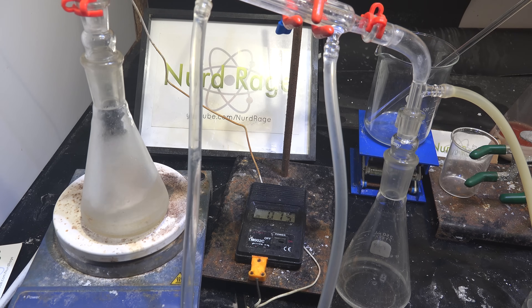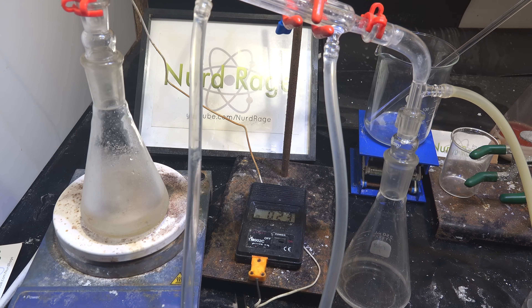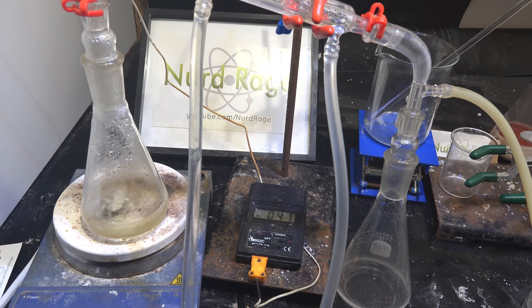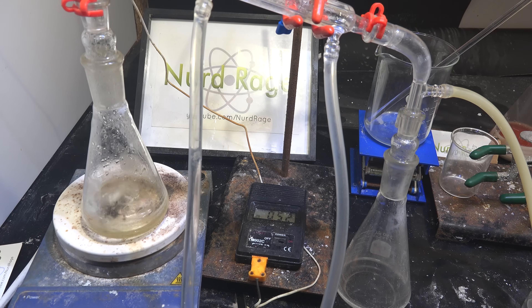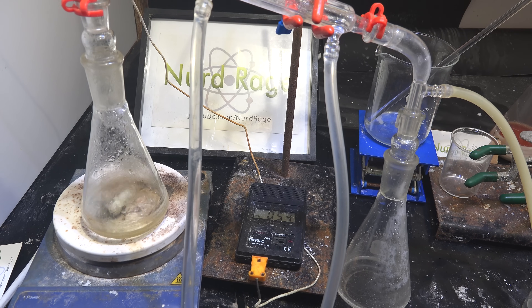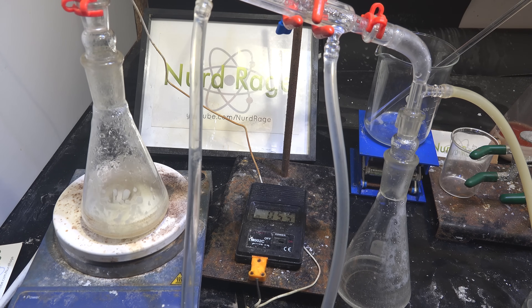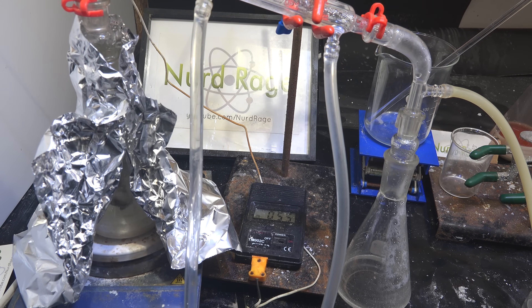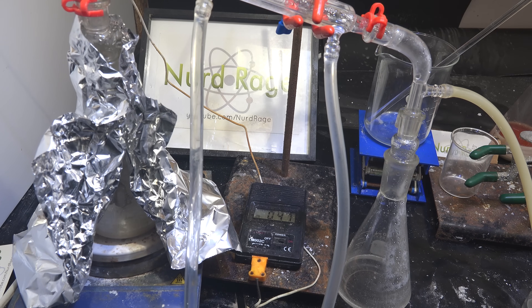Now we vacuum distill the solution to get dry guanidine chloride. My vacuum source is the aspirator pump I showed in a previous video. I'm using vacuum distillation because it's faster than regular distillation and gentler — you can use lower temperatures. Guanidine chloride is notoriously hygroscopic, so simple heating requires very high temperatures to render it dry, and we're going to need it as dry as possible for our synthesis of pyrimethamine. I set my hot plate to about 130°C and enclosed the boiling flask in a foil shroud to keep the heat in. After the last drop comes over, let it run for another hour to ensure the guanidine chloride is as dry as possible, then quickly transfer it to an airtight container.